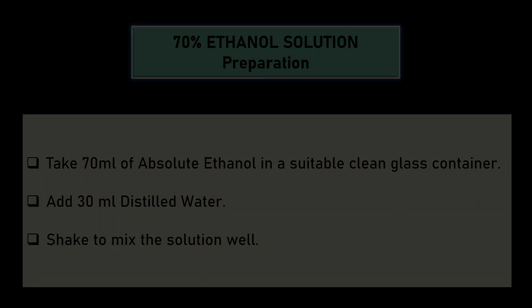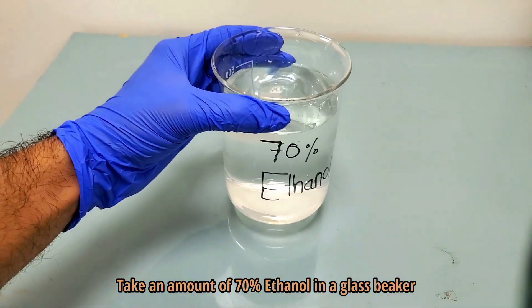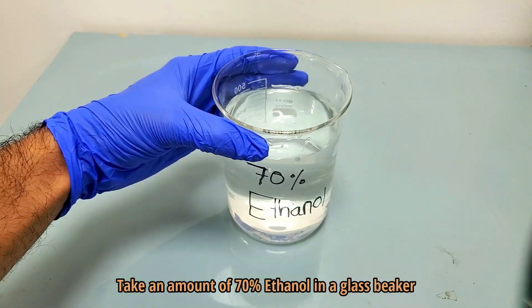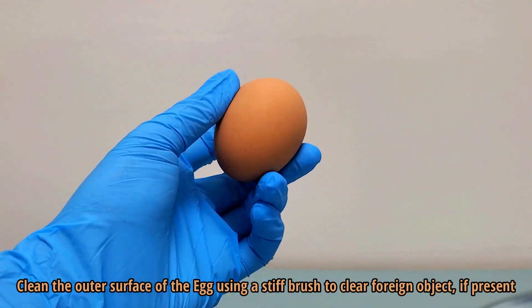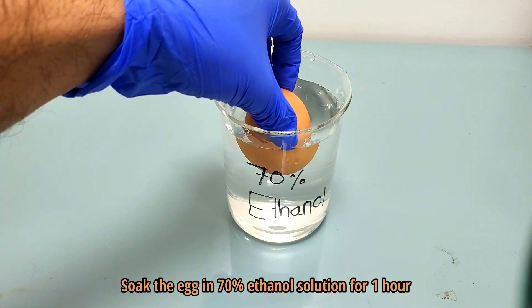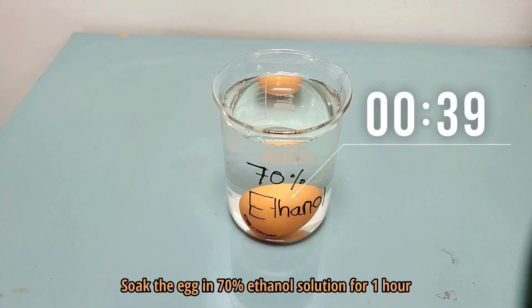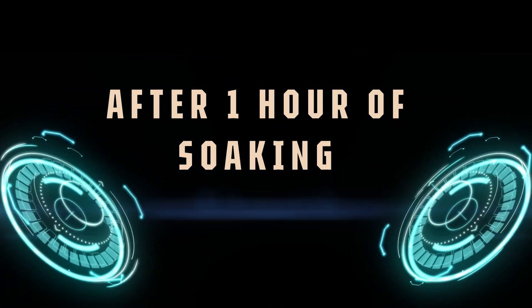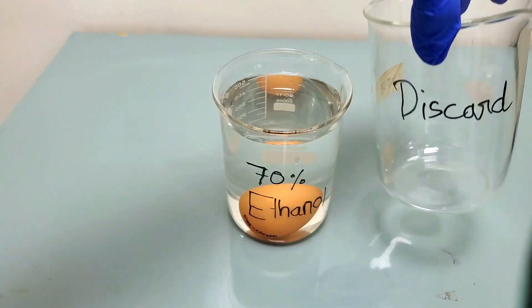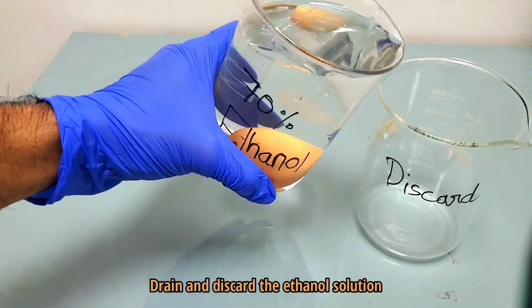In the main procedure, we first need to disinfect the outer shell of a chicken egg. Take an amount of 70% ethanol in a glass beaker. Choose a fresh chicken egg and clean the outer surface of the egg using a stiff brush to clear any foreign objects if present. Now soak the egg in 70% ethanol solution for one hour. After one hour of soaking, drain and discard the ethanol solution.